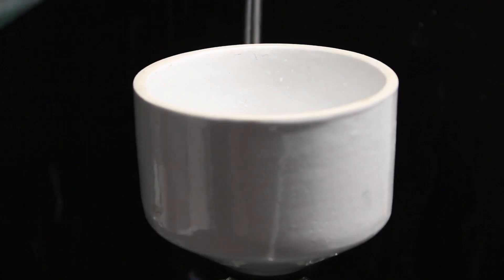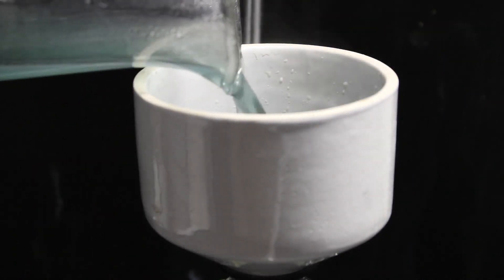These impurities are removed by means of a Buchner funnel. Gravity filtration would also suffice.